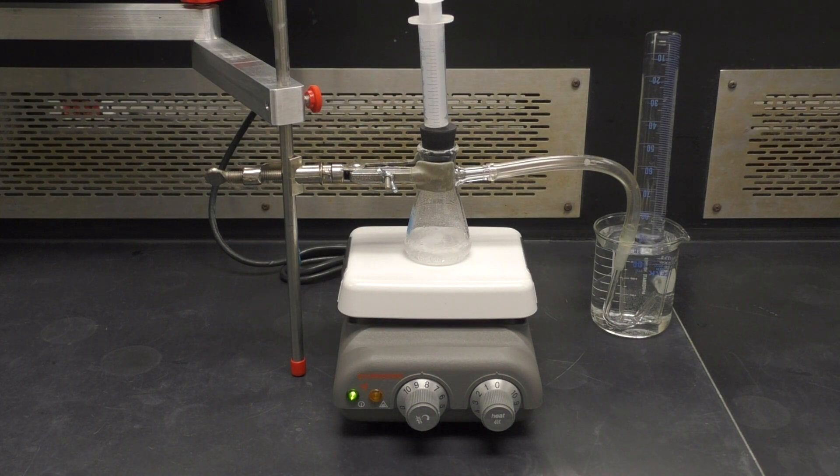Hopefully this guide was helpful in demonstrating how to set up a gas collection apparatus. We hope you learn a lot in lab, and have fun doing so!